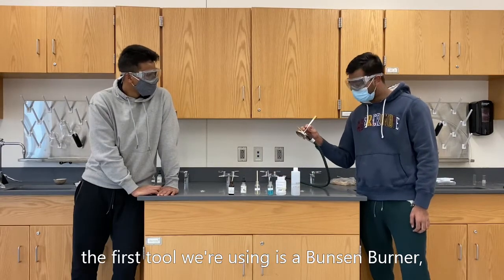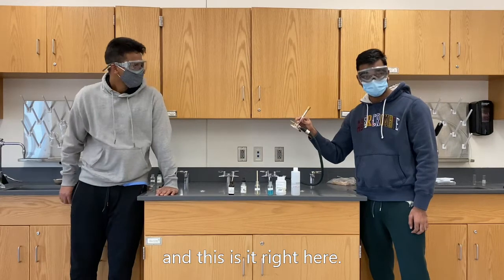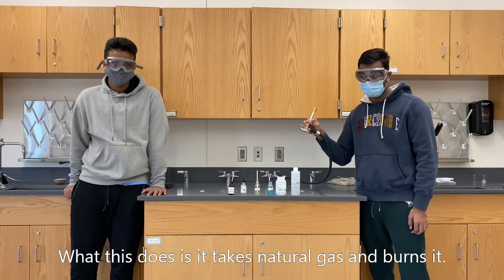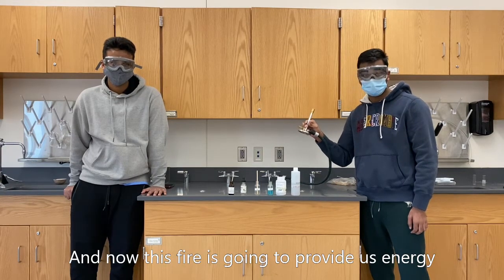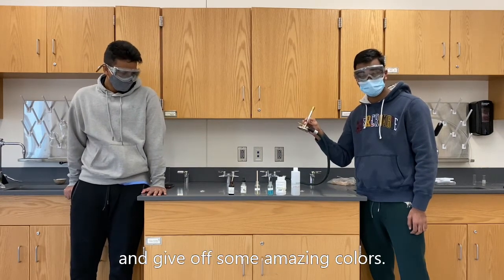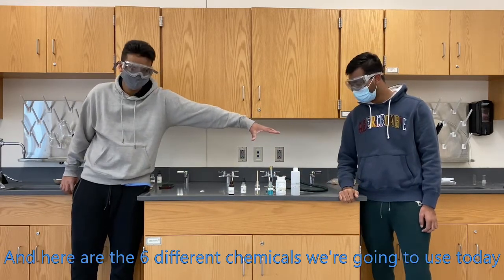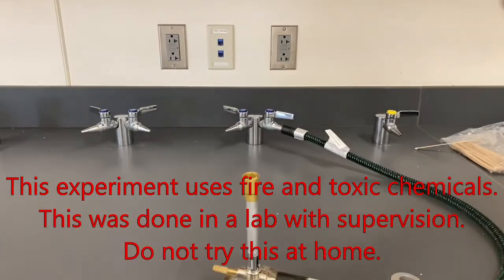Alright kids, the first tool we're using is a Bunsen burner. And this is it right here. What this does is it takes natural gas and burns it to create a fire. And now this fire is going to provide us energy to excite the electrons in the chemicals we're going to be burning today and give off some amazing colors. And right here are the 6 different chemicals we're going to use today to create all these different bright colors that you'll see very soon.